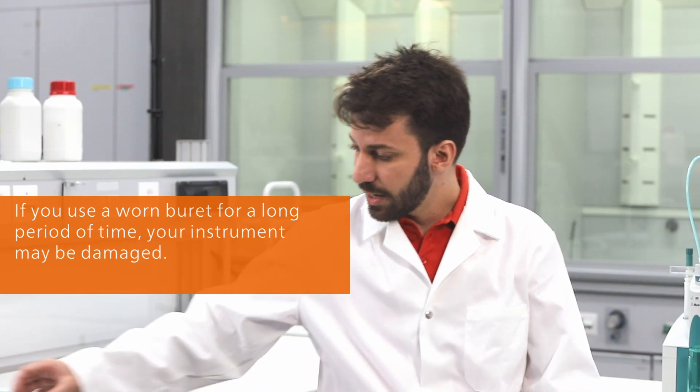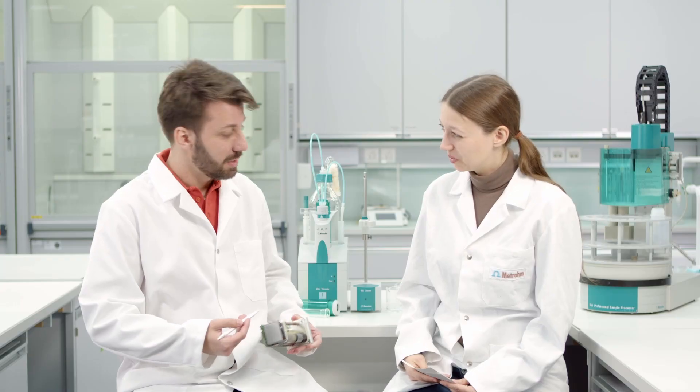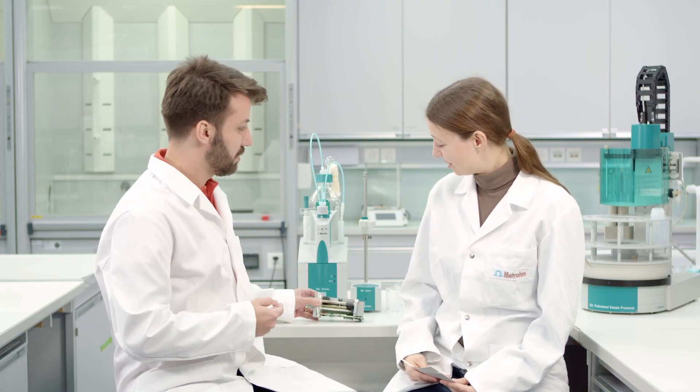The worst case that we can have is a leakage that can damage the dosing drive itself. And you could avoid it. What can customers do to prevent such a disaster?